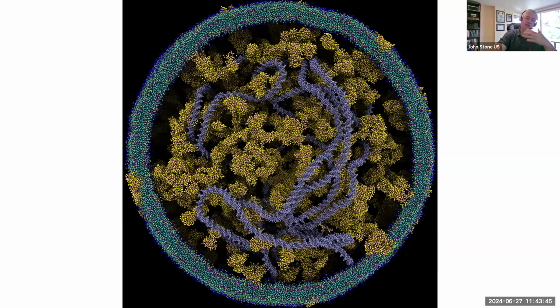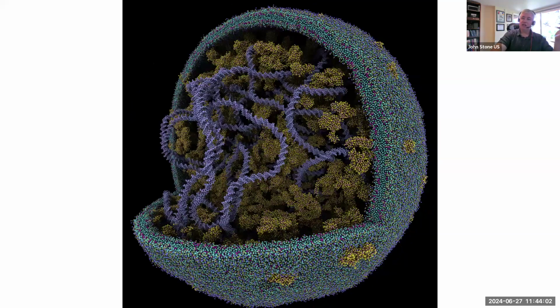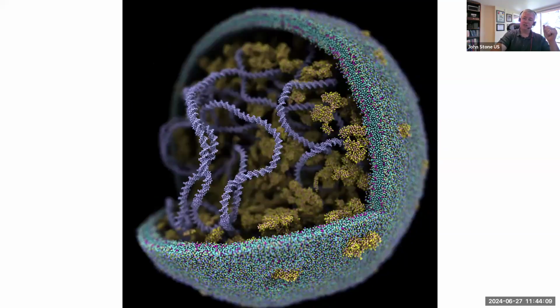Then you can start doing things, chop open or make different atom selections. VMD allows you to make geometric atom selections, so you can use equations to select things that are interesting to see based on their spatial coordinates. That's how you do a cutaway like this. And then you can orient the camera and so on. I thought I'd just show you these, they're kind of fun to look at. And then the last one, I just tilted a little different angle and gave it some depth of field. So you can see the things in the foreground are in the crisp plane of focus, and the things in the background are blurred away.